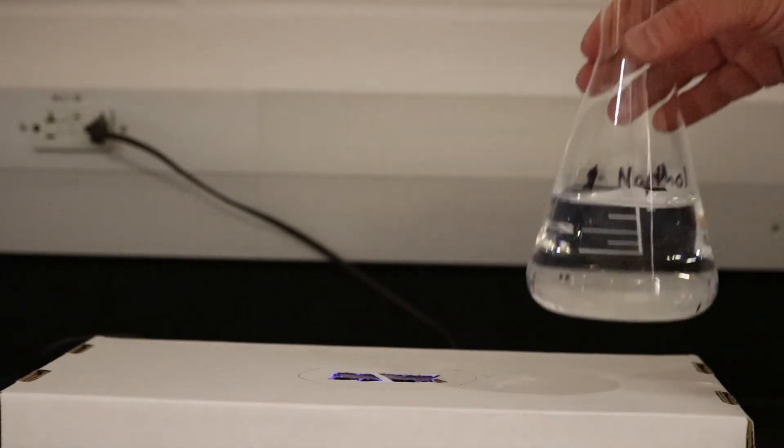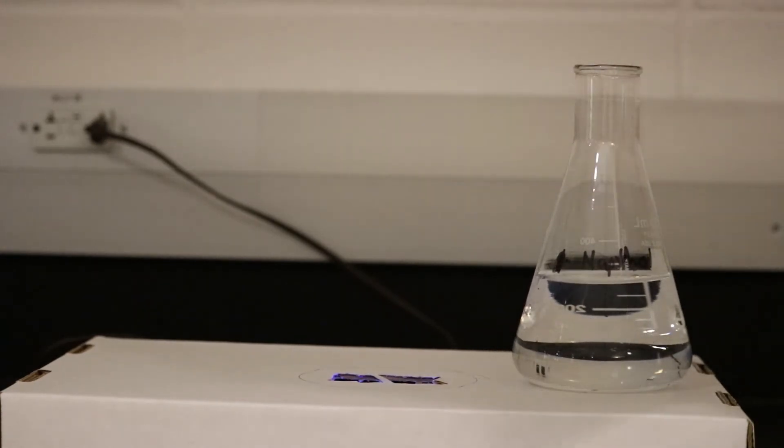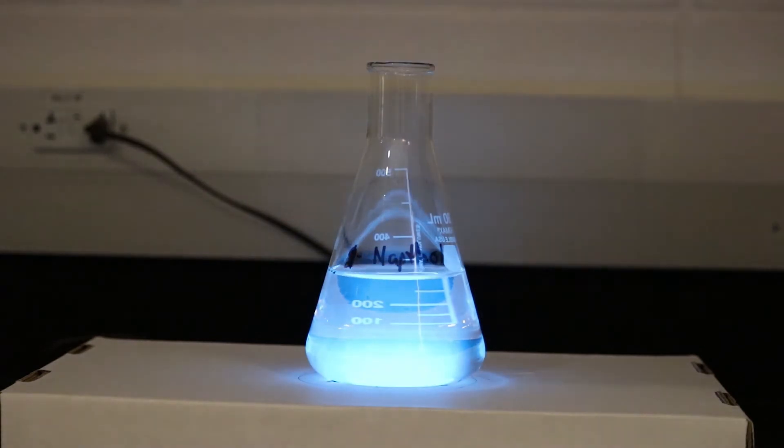The next one that we'll look at is Naphthol. I like Naphthol because it gives us a really significant color change. You can see that the solution here is clear and colorless, but as soon as I expose it to the ultraviolet light we get this bright blue color emitted from our solution.